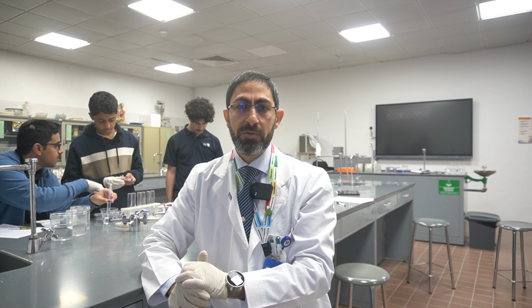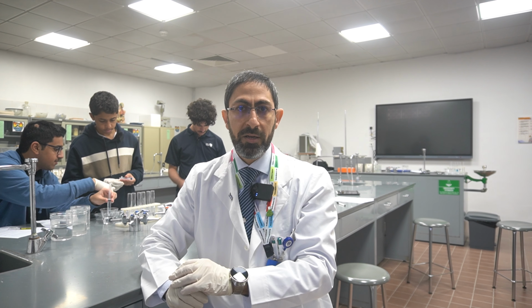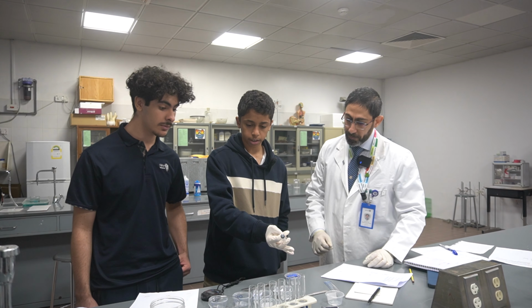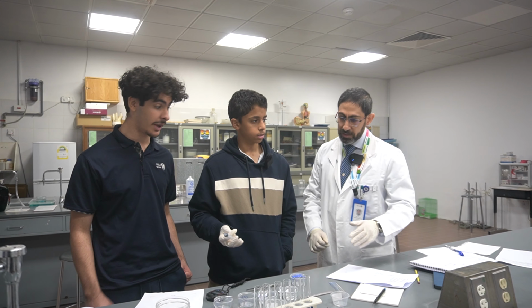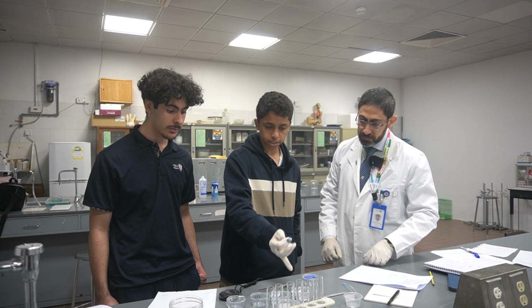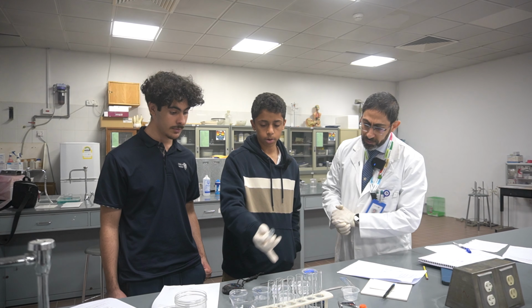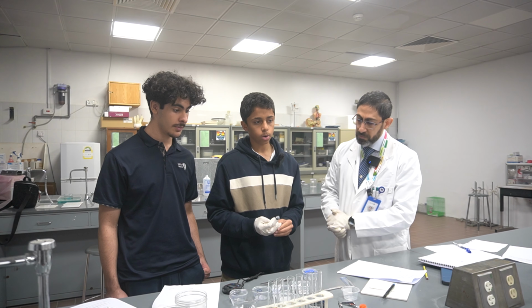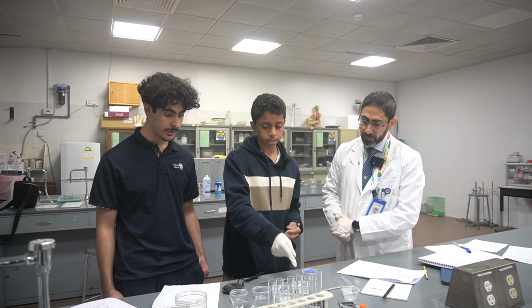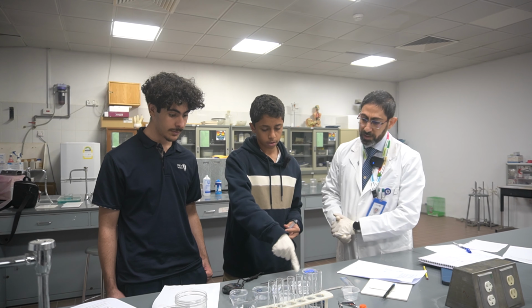Now, I will make use of those 10 minutes in order to interview the students and let them work. What are you doing now? So what we're doing right now is we're making a serial dilution. Basically, this is 10% NaCl. And we're trying to find out how osmosis is affected by the percentage of NaCl solution.